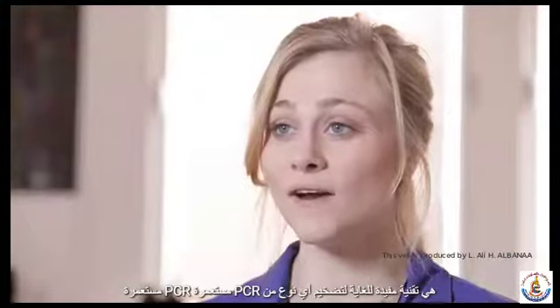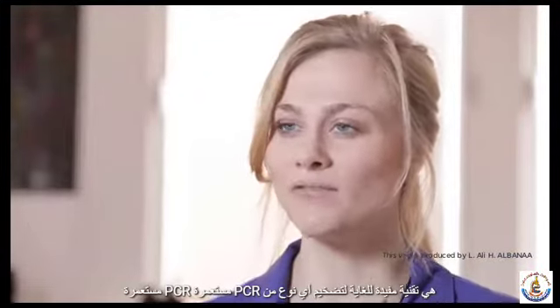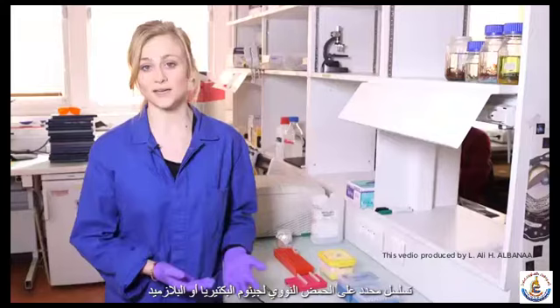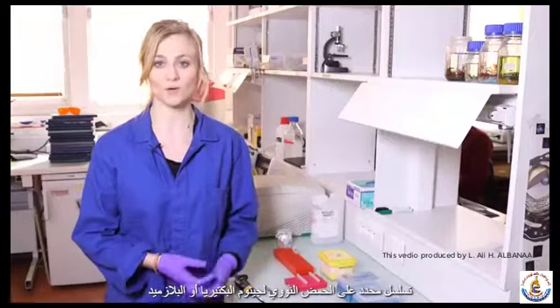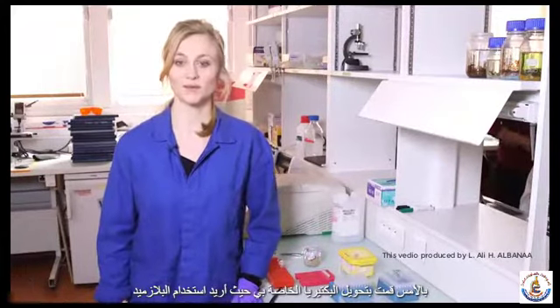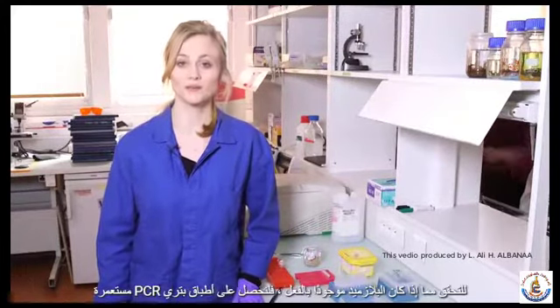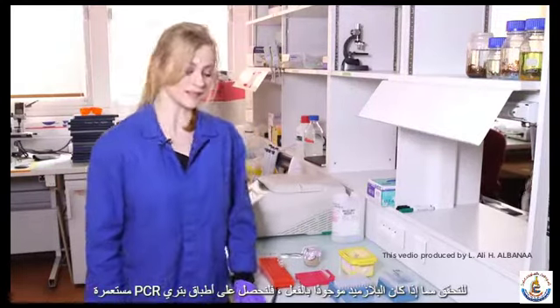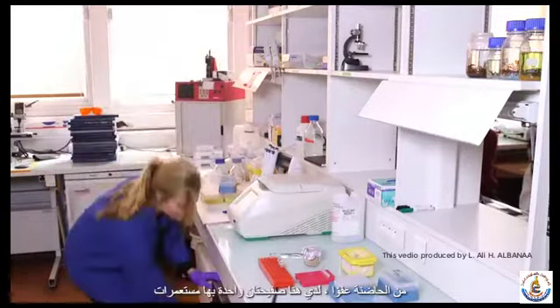Colony PCR is a very useful technique to amplify any type of specific sequence on either the DNA of the genome of a bacteria or a plasmid. Yesterday I transformed my bacteria with a plasmid, and now I want to use colony PCR to check if the plasmid is actually there. Let's get my Petri dishes from the incubator.